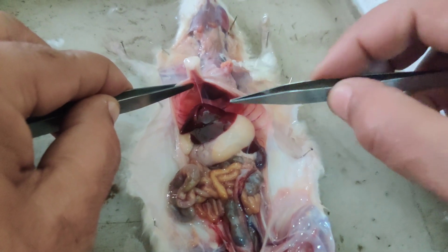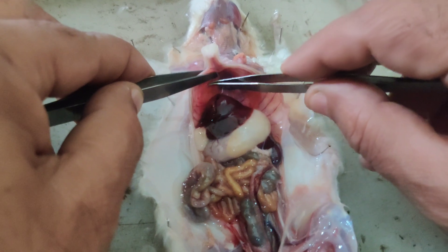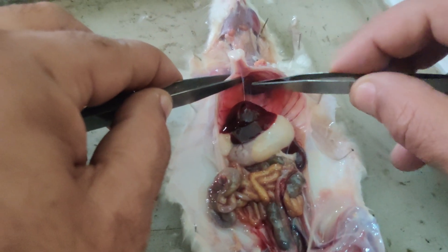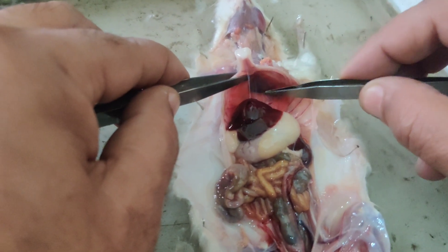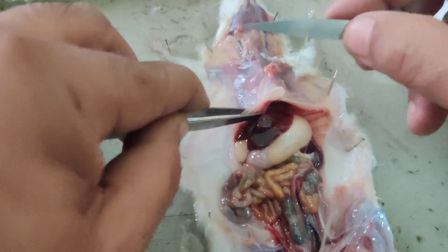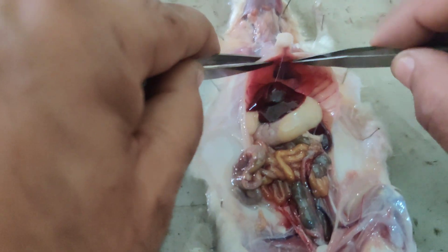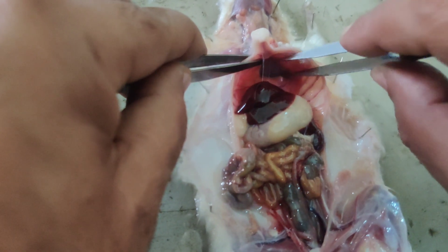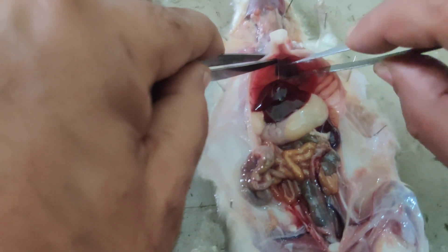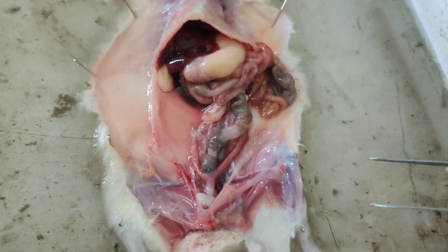Here you can see the diaphragm — this is the diaphragm, which is the partition. This is the abdominal cavity and this is the chest cavity. This muscular partition is the diaphragm, which helps in breathing.